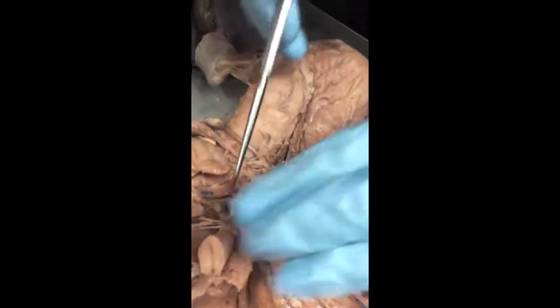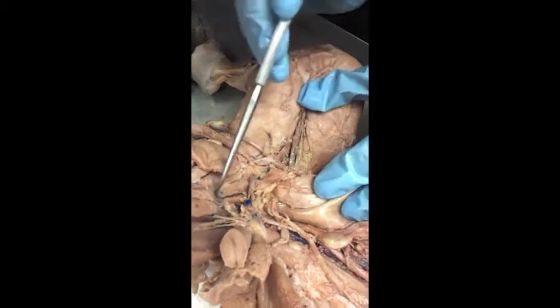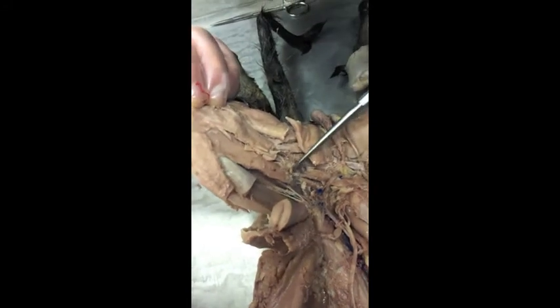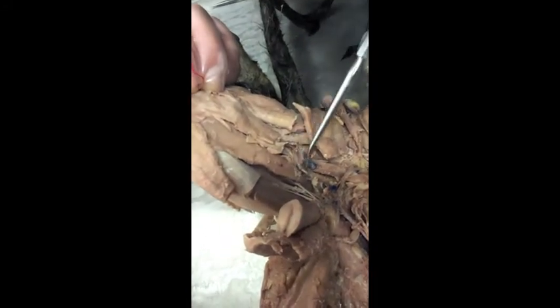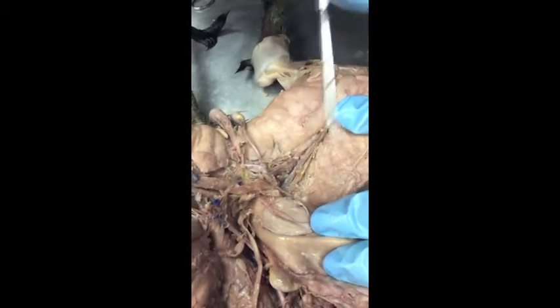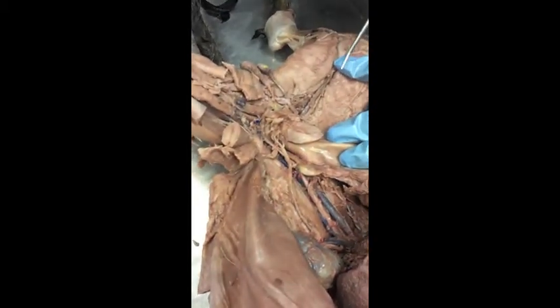So, well, we'll try to do it over here. So they're here, but they're not colored and pretty. So this big blue one, of course, is going to be the femoral vein, and then you can see running along with it is going to be the femoral artery, but it's not. So here's femoral vein and artery here. They're just not very colorful and pretty. All right, side by side with that femoral nerve.